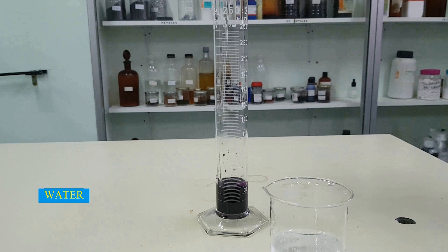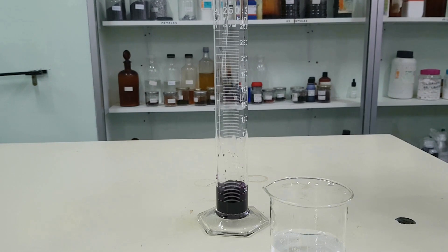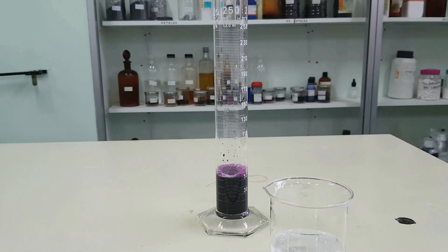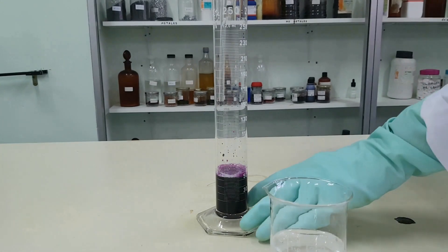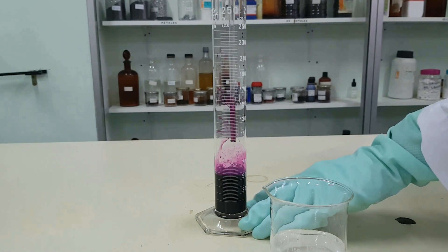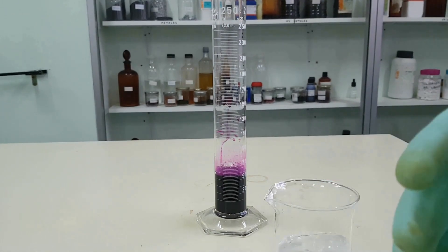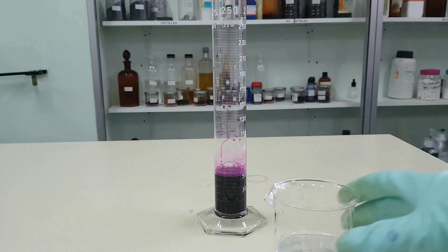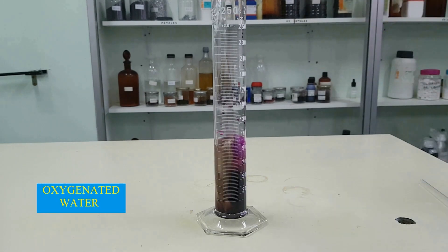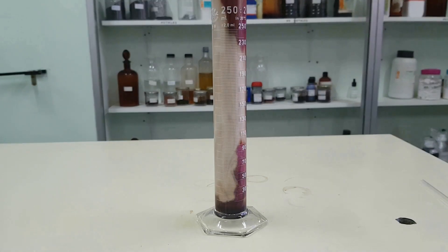Add some water. Stir with a rod. Add the hydrogen peroxide, and the reaction occurs.